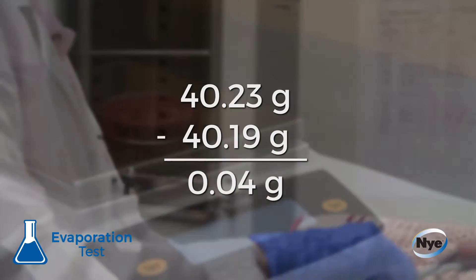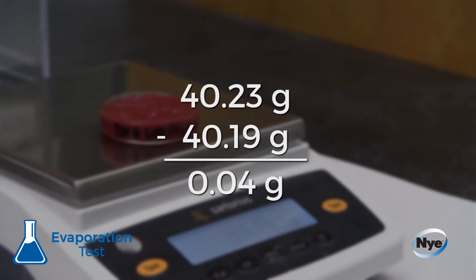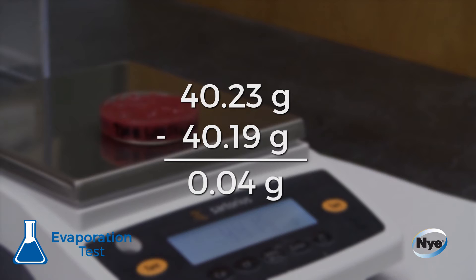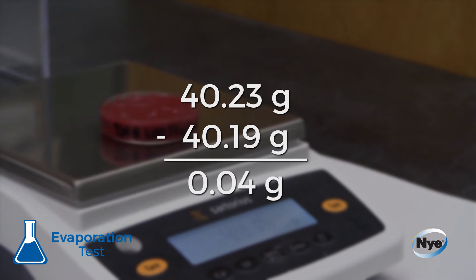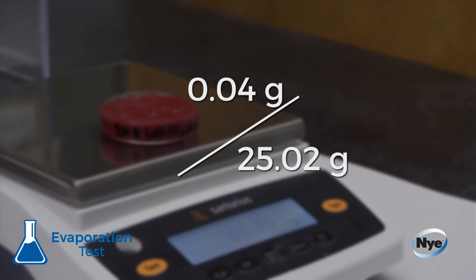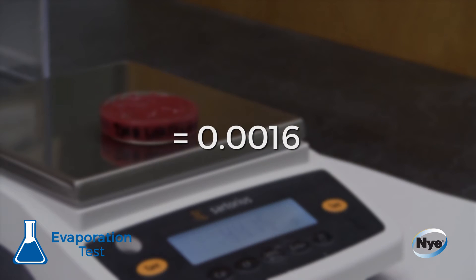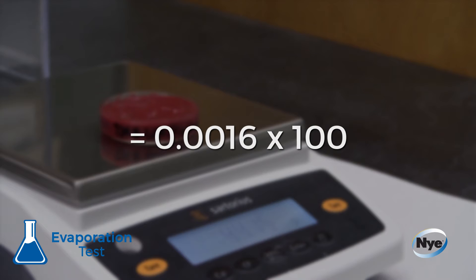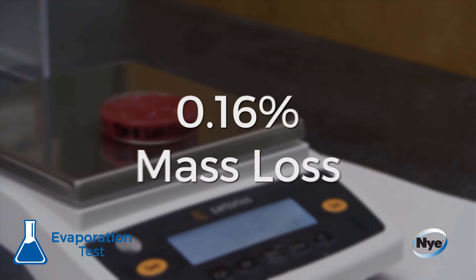The results of this test are calculated as a percent by subtracting the weight of the petri dish or beaker after the test from the weight of the dish or beaker before the test. This number is divided by the original starting weight of the lubricant and multiplied by 100 to report a percent mass loss.